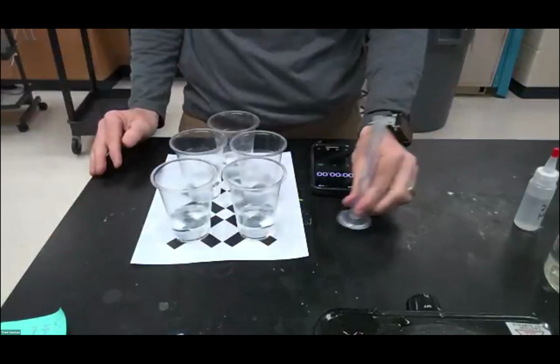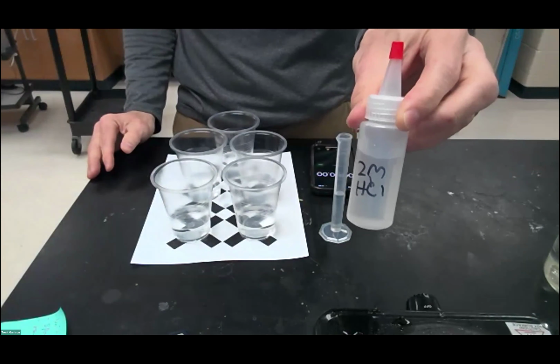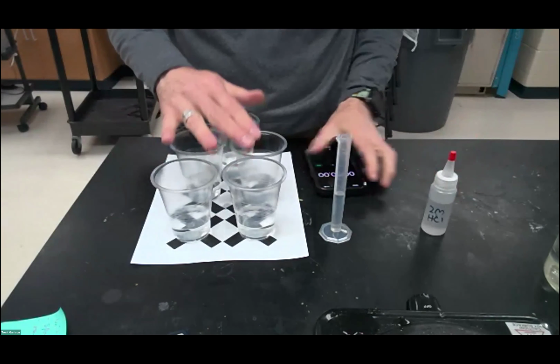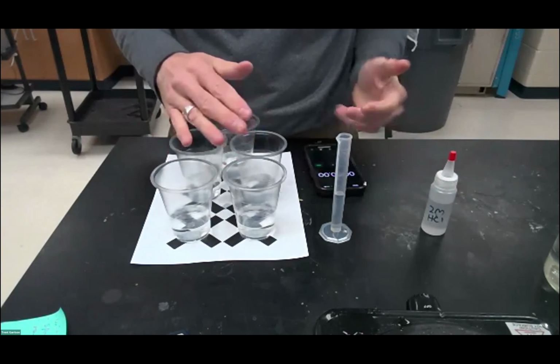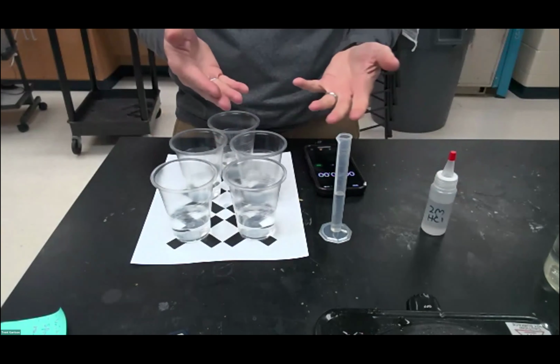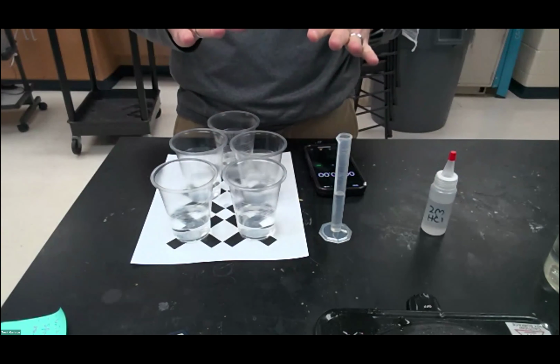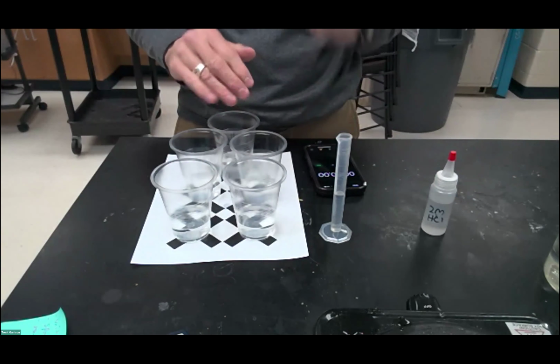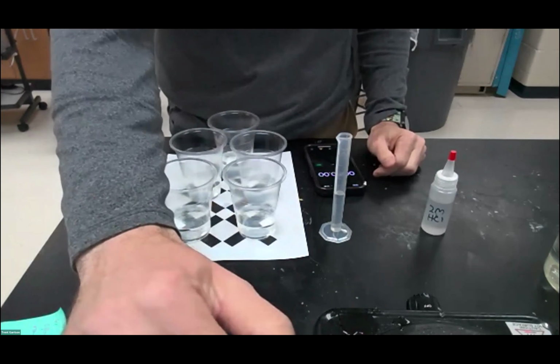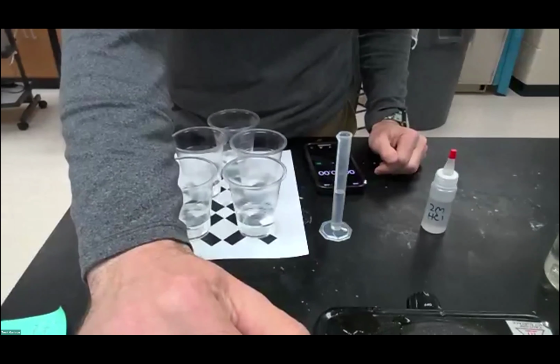Okay, so I have prepared 5 milliliters of 2 molar HCl, that's an acid, and it's going to react with the sodium thiosulfate, and it's going to create a colloid of sulfur that's just going to be floating around, and it's going to become solid, and it will then try to settle, and as it does, it will stop allowing you to see the view. So I'm going to switch my cameras right now so that we can see what I am talking about.